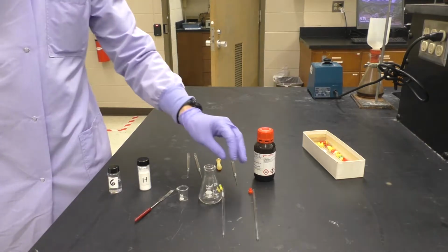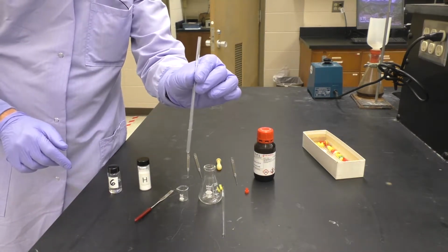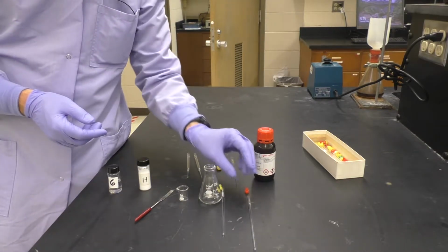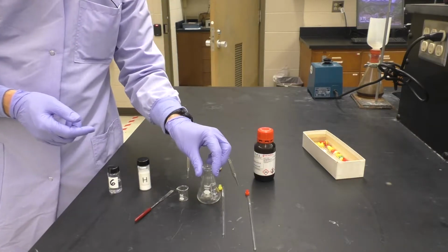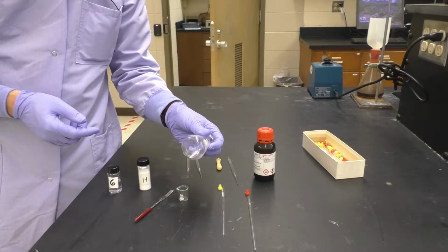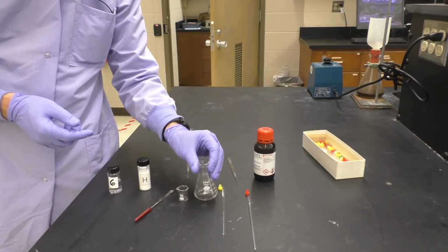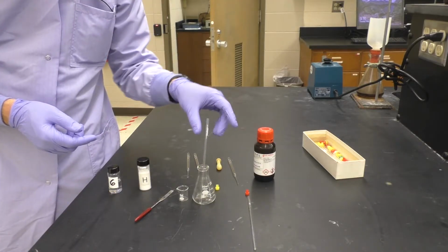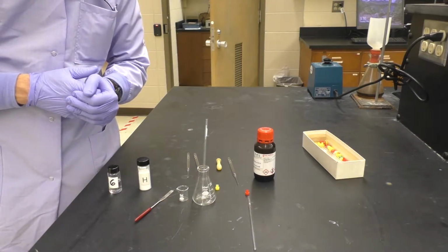We have here also NMR tubes. So here's a tube. We will place the sample and the NMR solvent in and then cap it with one of these NMR caps. We have a very useful Erlenmeyer here. It doesn't really matter the size. It doesn't have to be an Erlenmeyer, but it's very useful for taking the NMR tube and placing it upright so that it doesn't fall over and can stay upright during sample preparation.